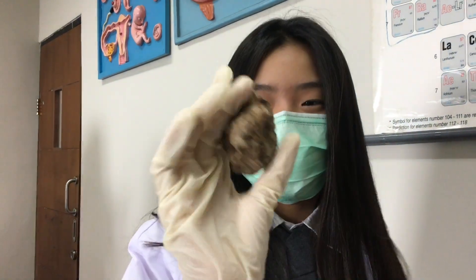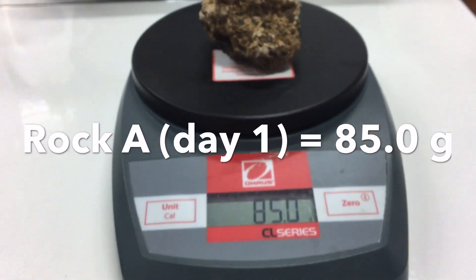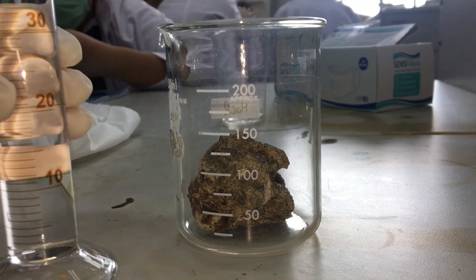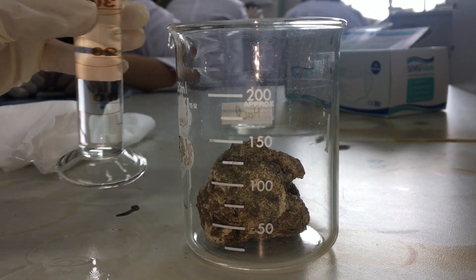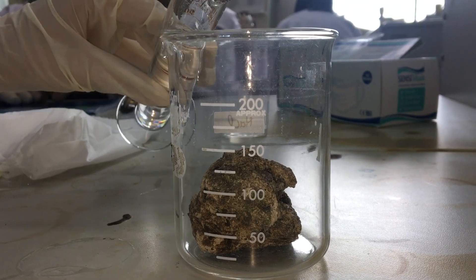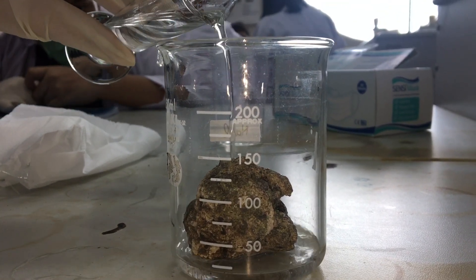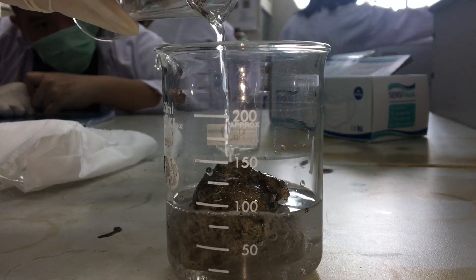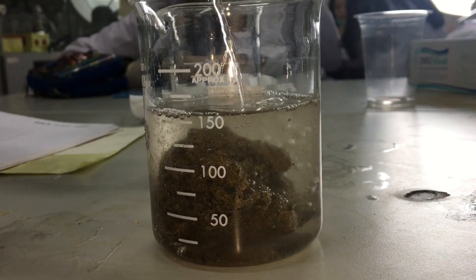Now we're going to measure the mass of the water. So first we're going to pour in the vinegar and see the reaction. We need more, so we're going to measure the mass of the vinegar.